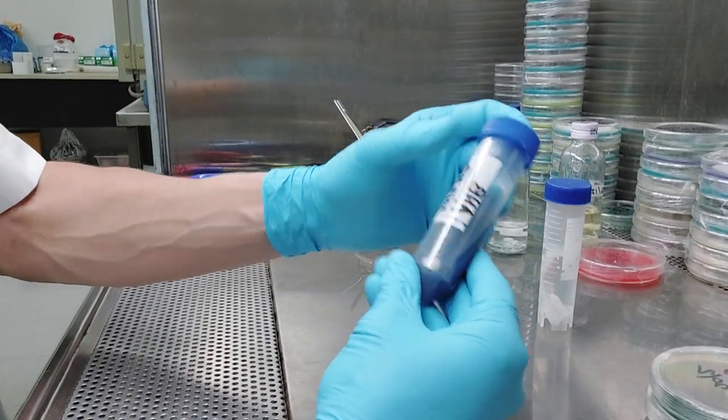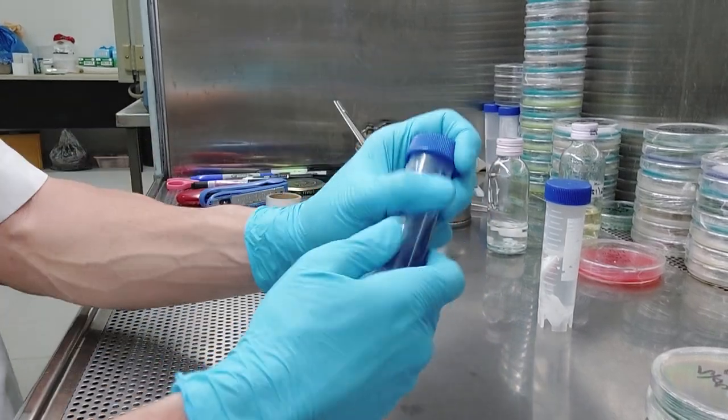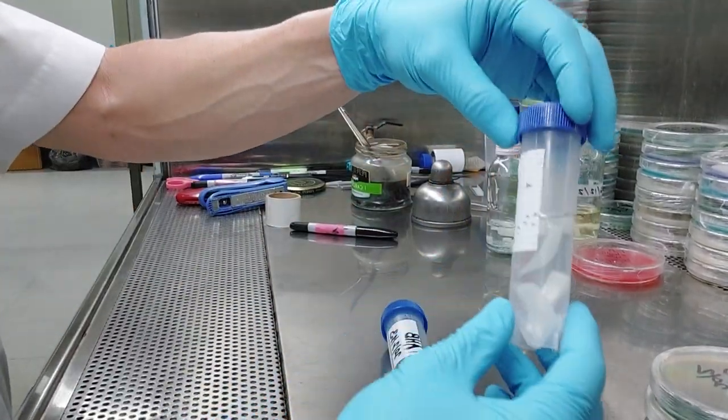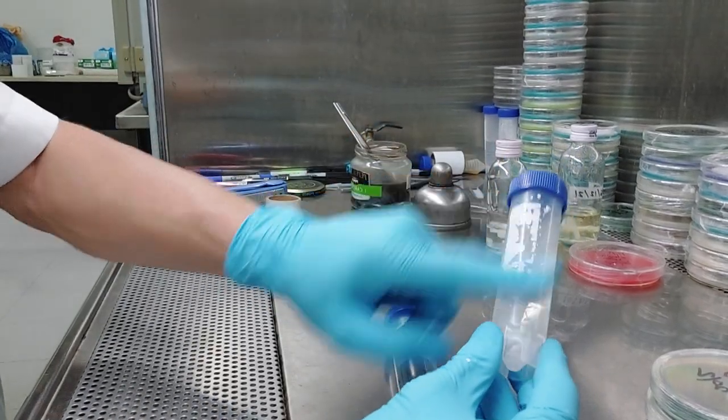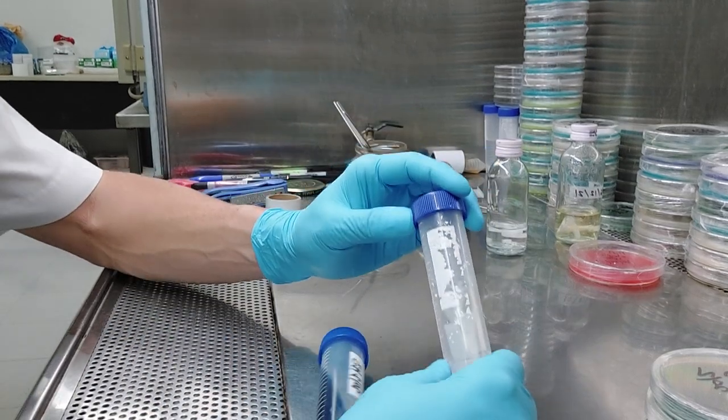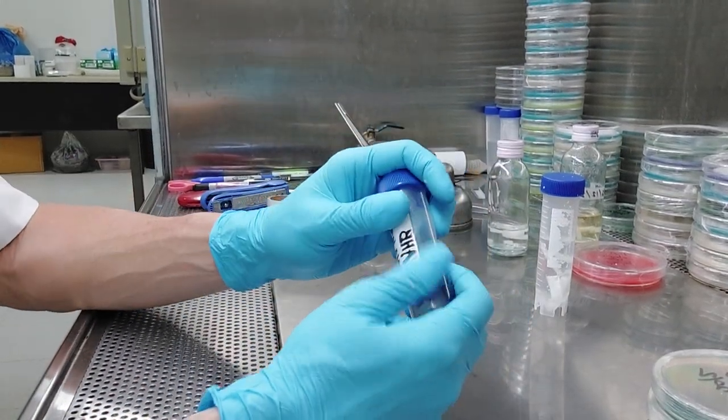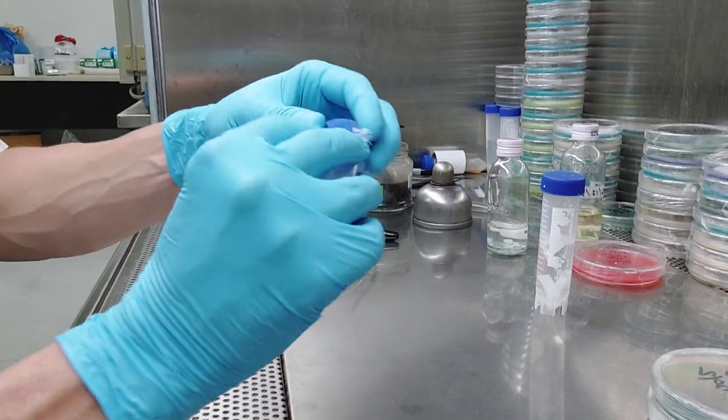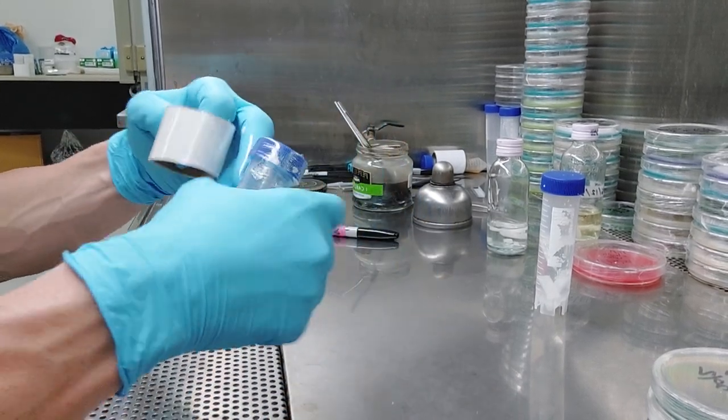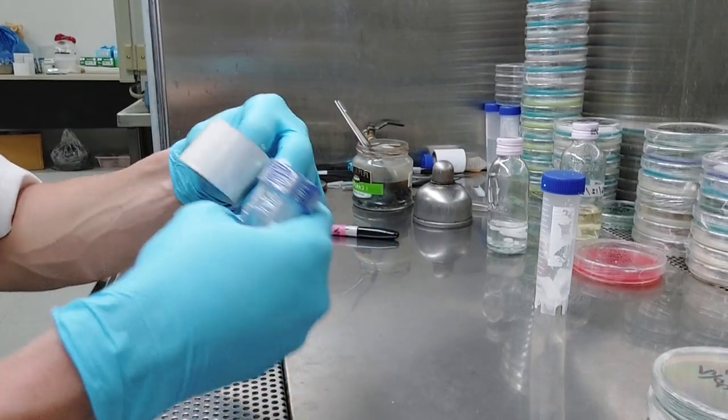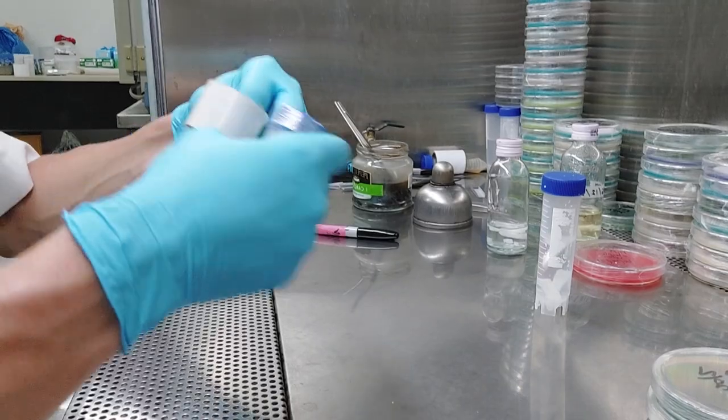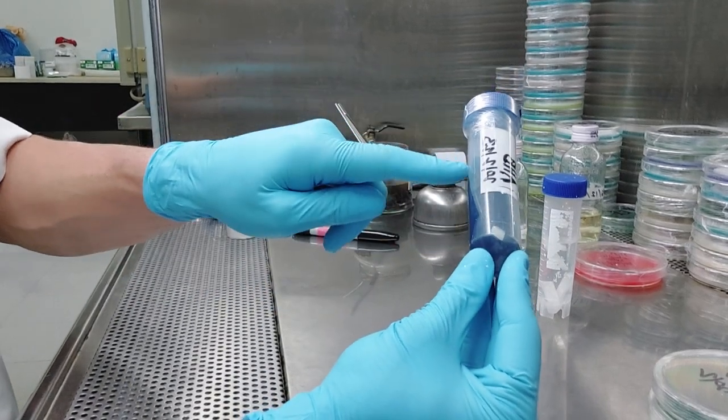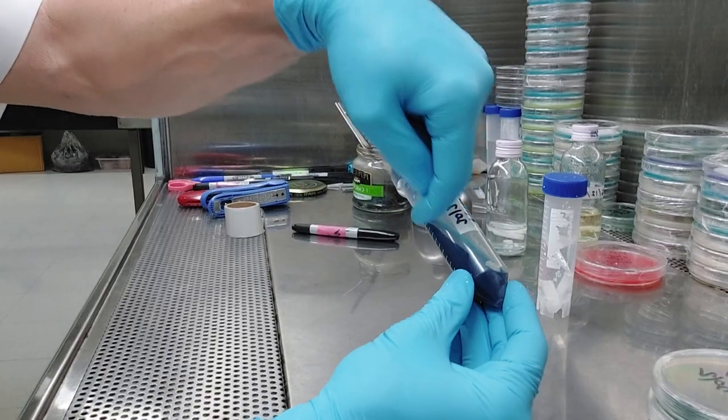Sharpies are great, but if you get this saturated and it's cold and wet and cold and hot and wet and it's got condensation under the tape and you're spraying it with alcohol, that thing, that label will rub right off. Notice how this one, this is a brand new tube. Already see how it's chipping off there. That's bad. That's as bad as having a contaminated culture, right? You pull that out and it's contaminated. So put a piece of cellotape over there and then also make sure you wrap the top. These things do not need oxygen. Guys, there's enough oxygen in there for that culture to live forever. I have noticed they will slow down and try to be a little bit like maybe cleaner and neater than I am, but I'm just noticed the videos have 15 minutes. So there you go. I give it a tap. Make sure that piece is in the bottom. I want it to grow from the bottom up.